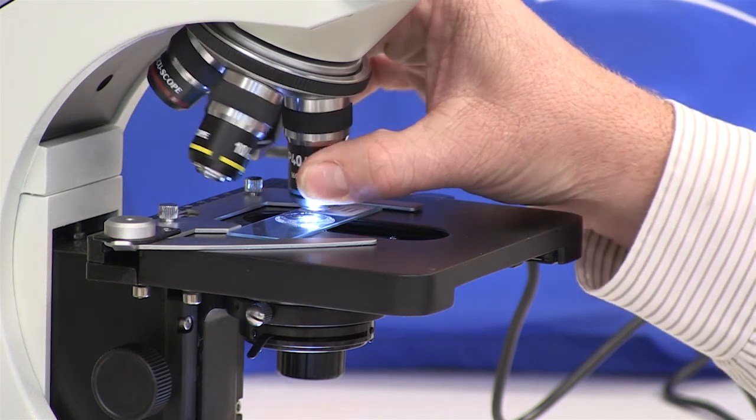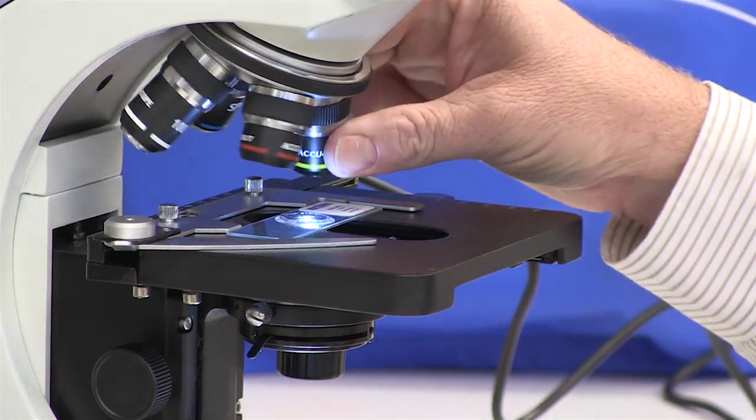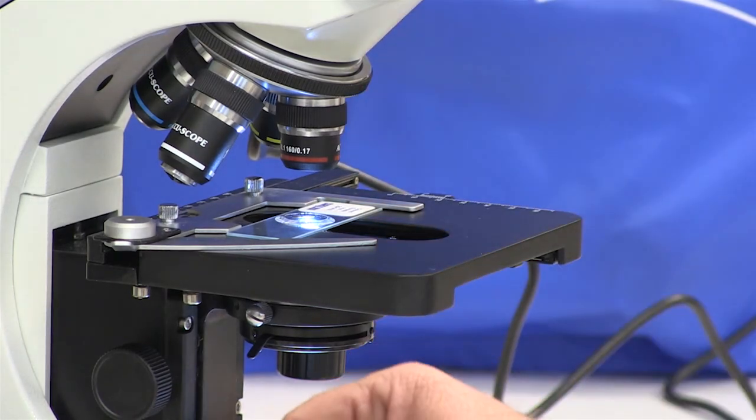The microscope is a wonderful tool and it can last many years if it's taken care of and used appropriately.